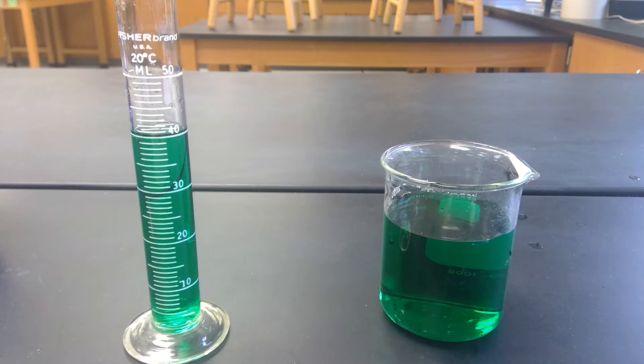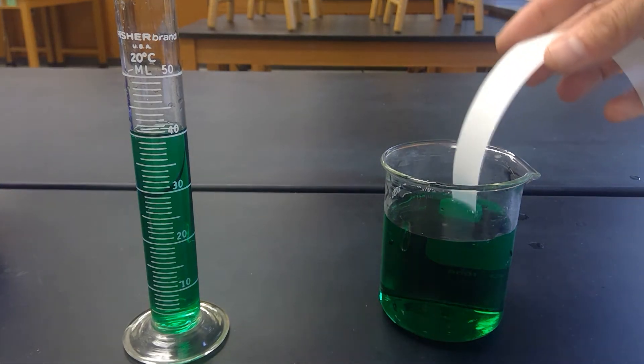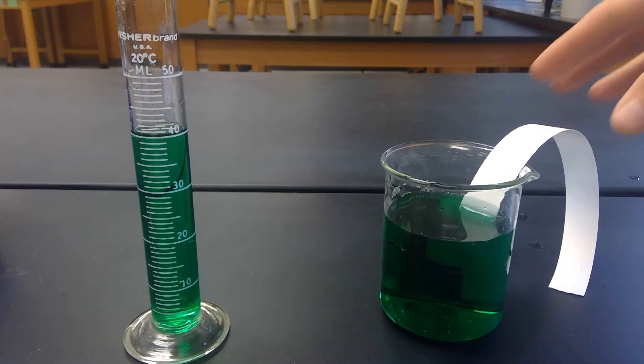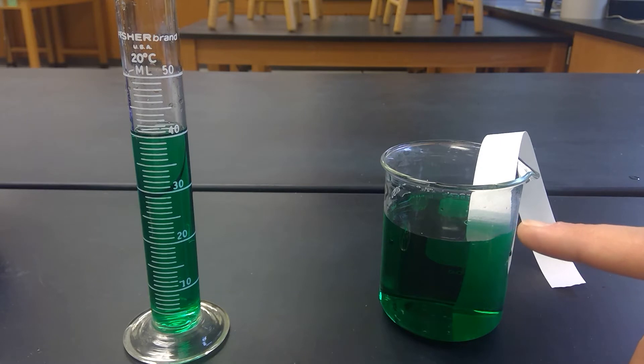I want to take a paper strip and just put it into this colored water. And I want you to pay attention to what happens to the water level on here as time goes on. So I'm just going to leave it there and continue on to the rest.